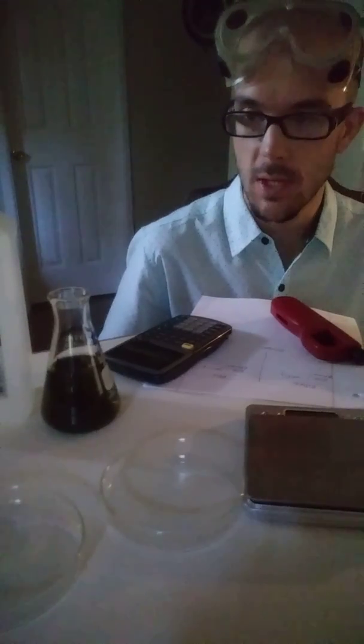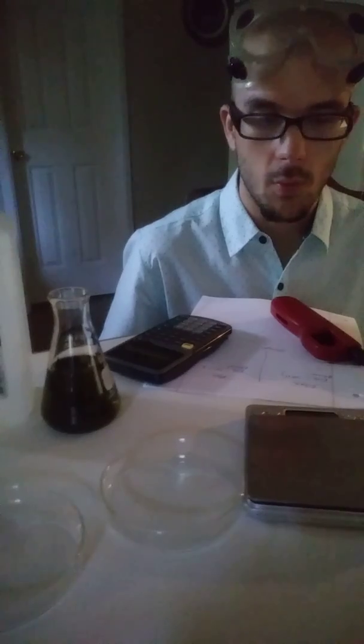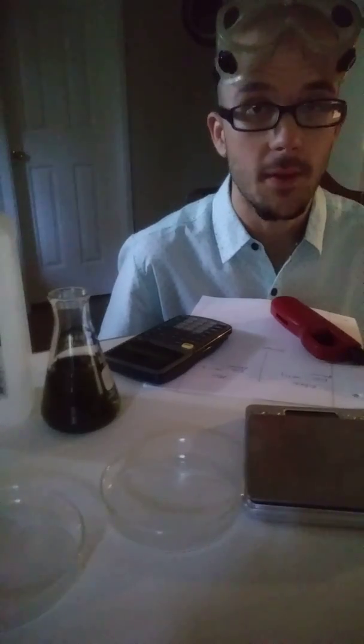Hi everybody, this is Mr. Nolan, and what I'm going to show you right now in this video is just a really quick demonstration for what happens when ethanol burns. This has been the central question of our unit and we are going to demonstrate this right now.